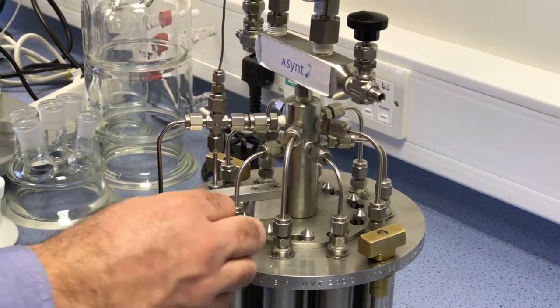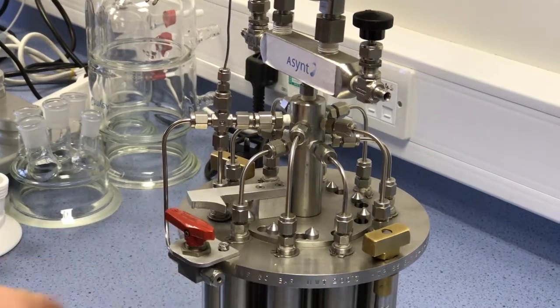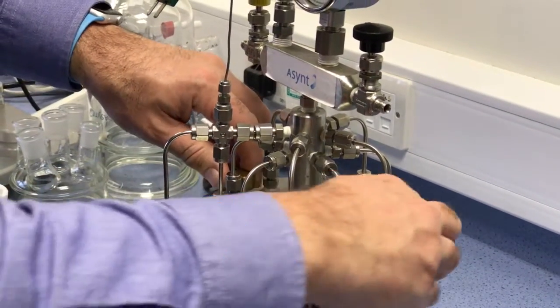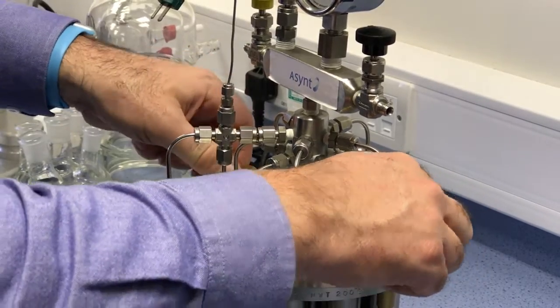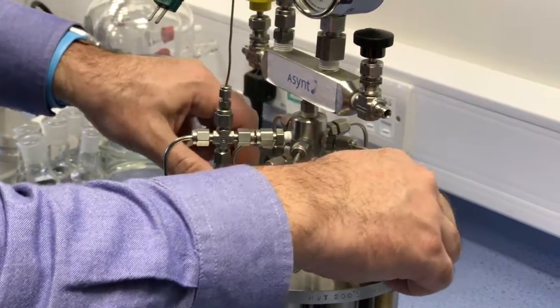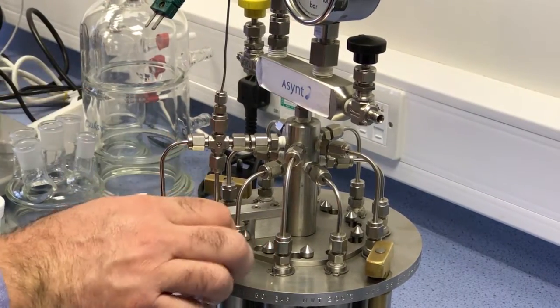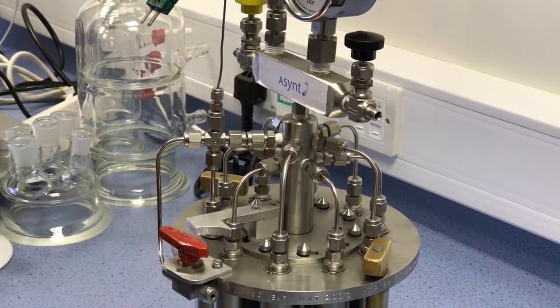So first of all we have to undo the safety valve. This would release any pressure if you're in use but not for the first time of course. And then we have to actually turn these clockwise a little bit. This takes the strain off the safety lock plate and we're able to move that into the open position.